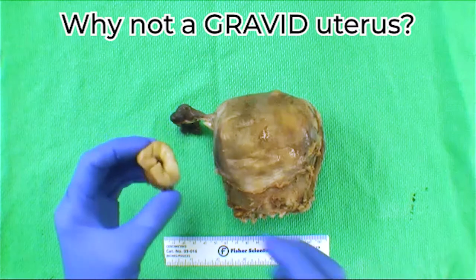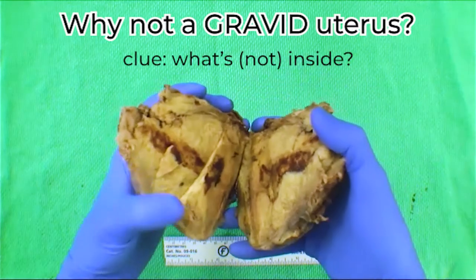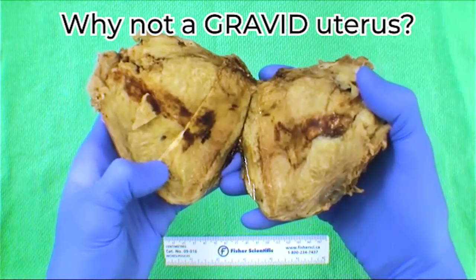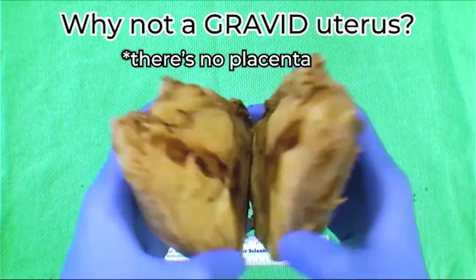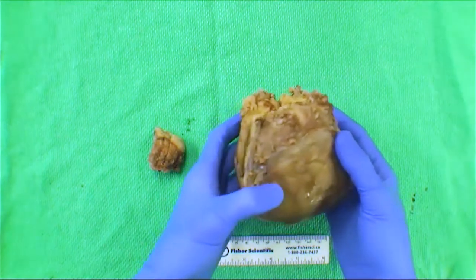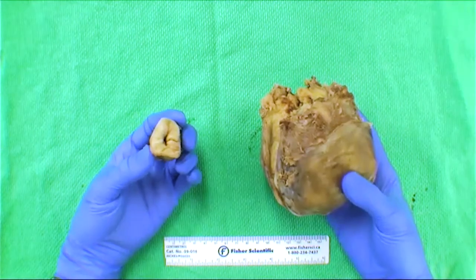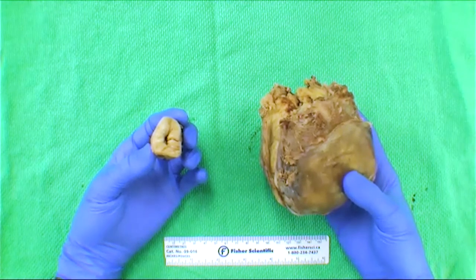Here's a clue: what was inside, or what's not inside? Exactly — there's no placenta, and usually the myometrial or endometrial cavity is much larger. It's very unlikely that you're going to get a gravid hysterectomy. Previous teaching says that if you do get one, it's most likely a medico-legal situation, so you have to be careful.